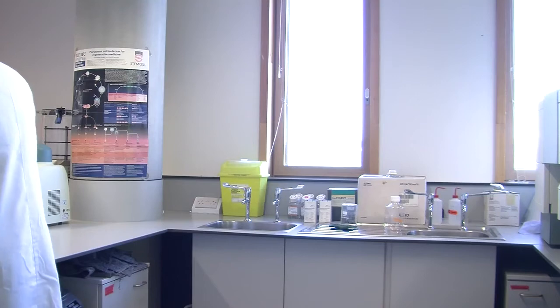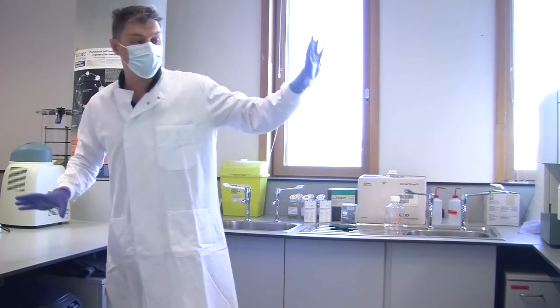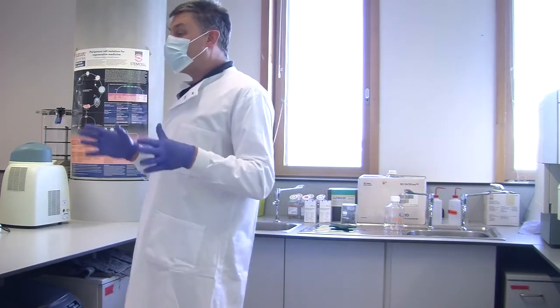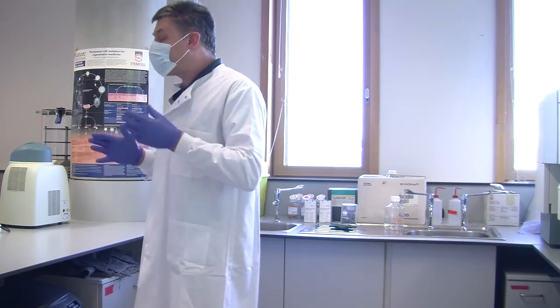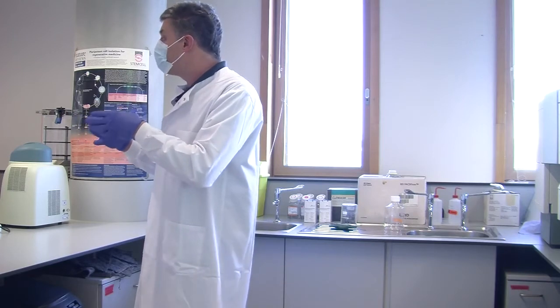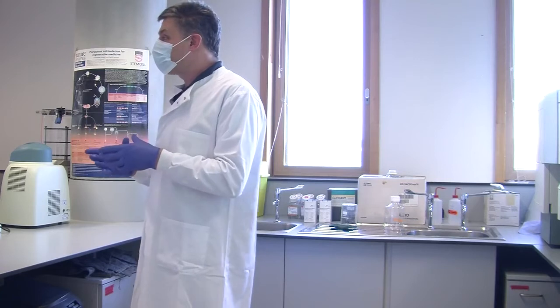Yes. So you've got all, I mean, this has no real automation, both in the software and on the instrument. But one of the instruments that I used to be the application specialist for will run a 384 well plate in under 10 minutes through a flow cytometer, and a 96 well plate in under 3 minutes.